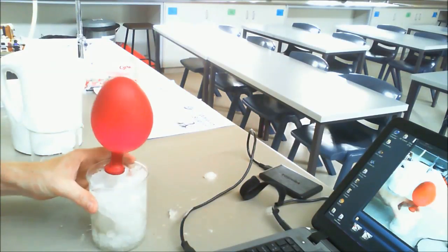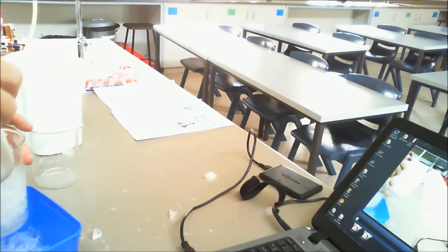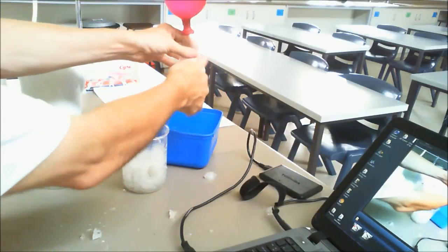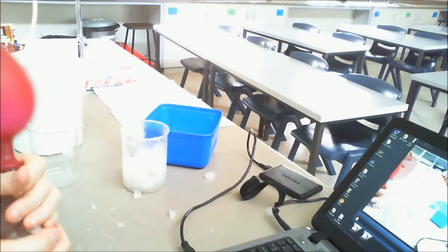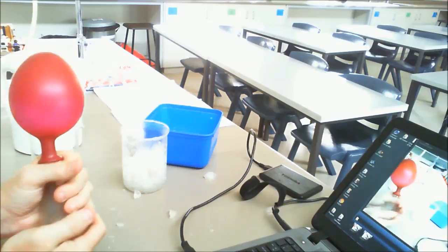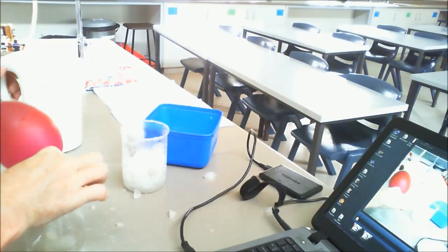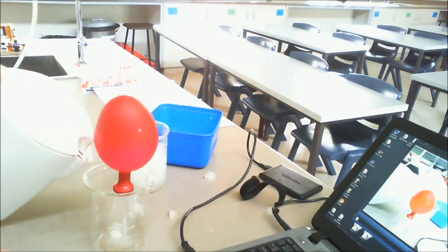Now what we'll do with this is take it out. Okay, we'll basically brush off the ice. Just warm that a little bit, because we're going to be transferring it into a beaker of hot water, and what we don't want to do is have it very cold and then put it in hot water, because that will break it. So just warm that up a little bit. That should be fairly good, and then what I'll do is pour in some hot water here from the kettle.